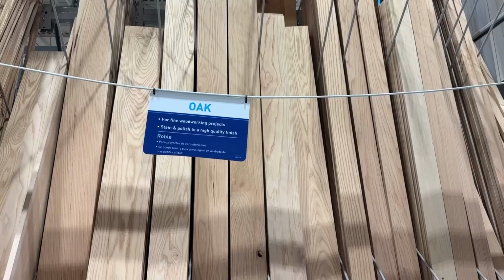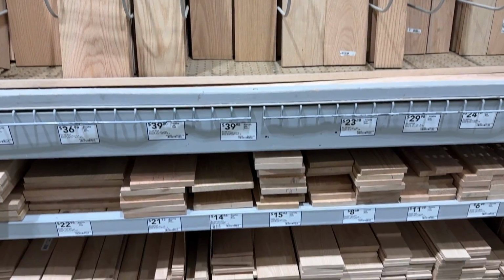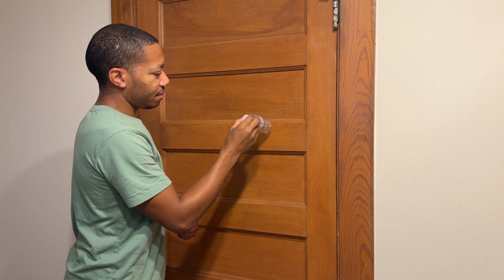Recall in the last video I demonstrated how I went to Home Depot one day when I was feeling nerdy, and I took a portable infrared spectrophotometer with me to the store. And while crouched in the shelves, I went to the vinyl flooring section to sample several different qualities of vinyl flooring. And then I went to the lumber yard where I sampled several different types of lumber, such as pine, oak, and fir. Also in that video, I said a tree is as different from a water bottle as the wood is from vinyl flooring.